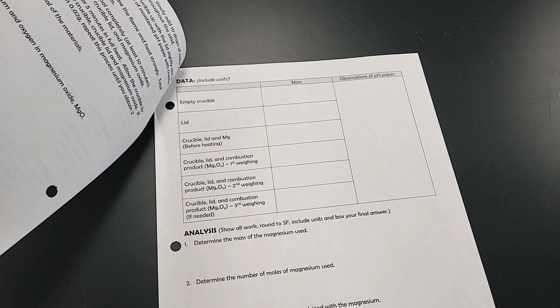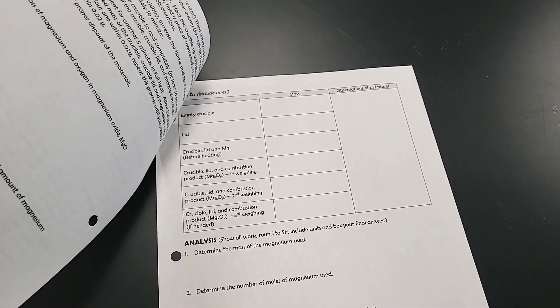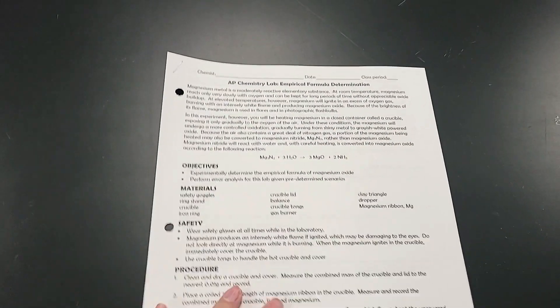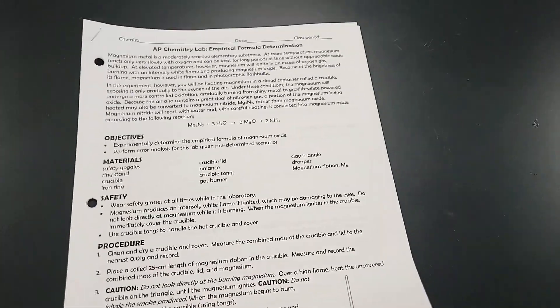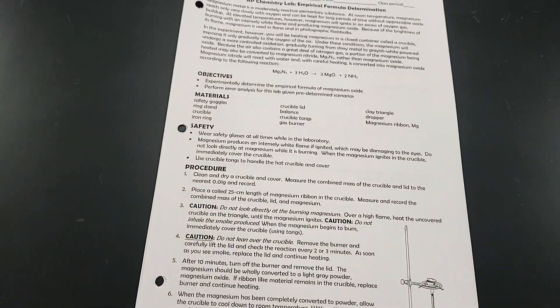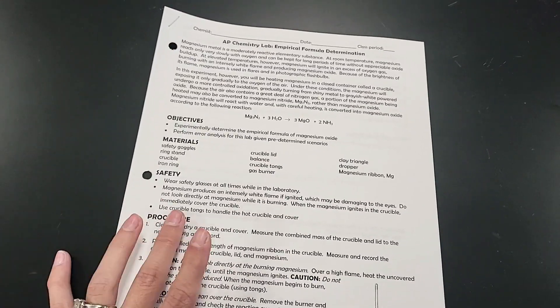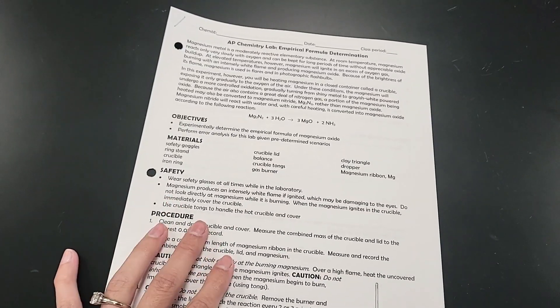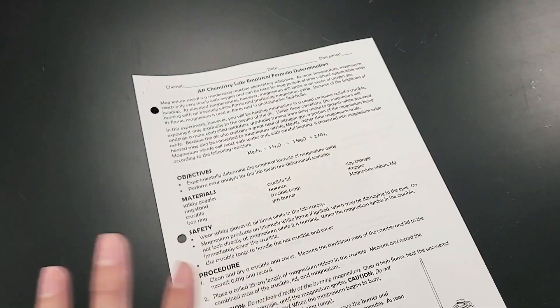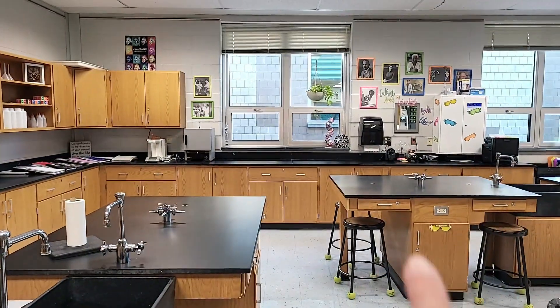This is a pretty lengthy lab because they have to do multiple masses, so they've got a lot of measurements to take, and obviously it takes a while for things to cool down. I did do a pre-lab video, so I'm hoping they'll be able to complete the lab and the calculations without me having to explain all the safety again, since they already watched that pre-lab video.